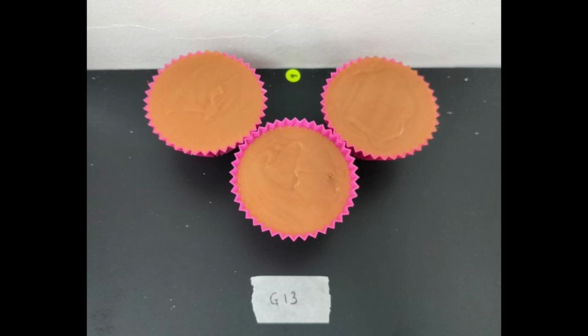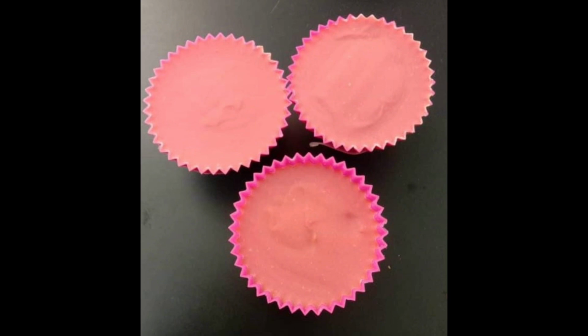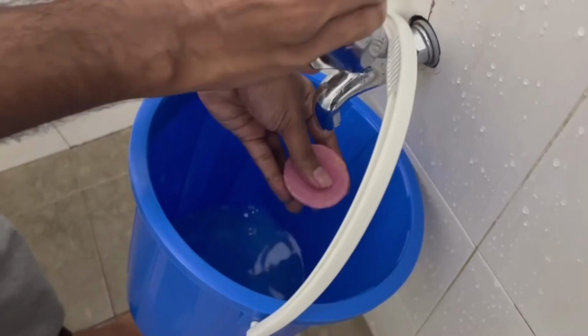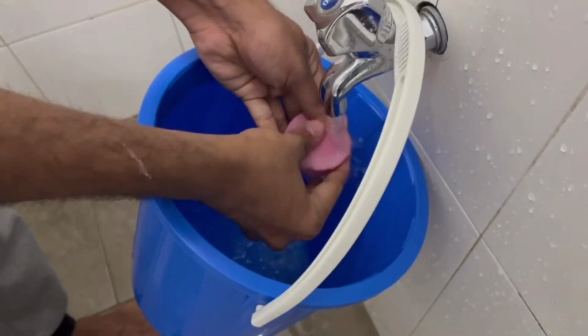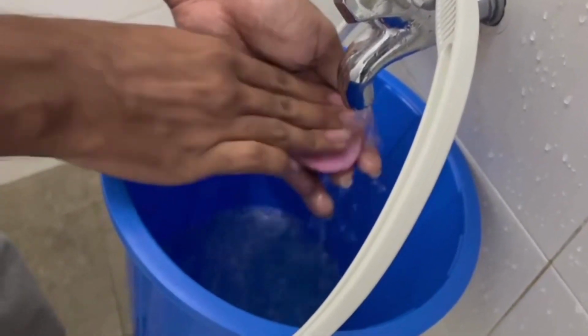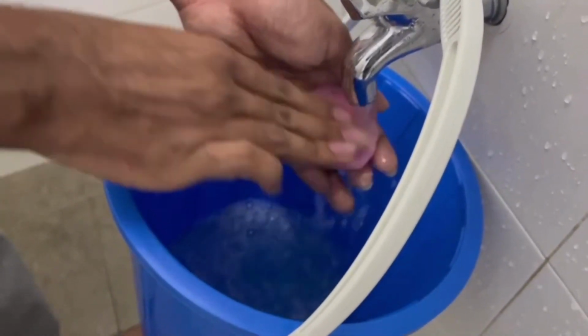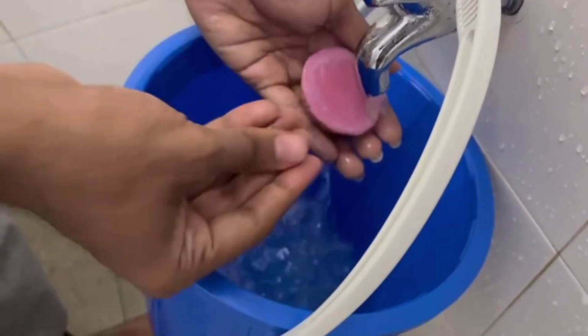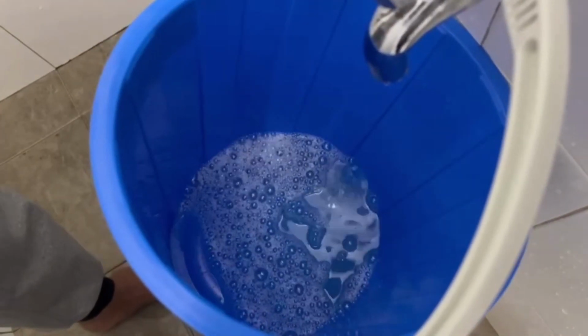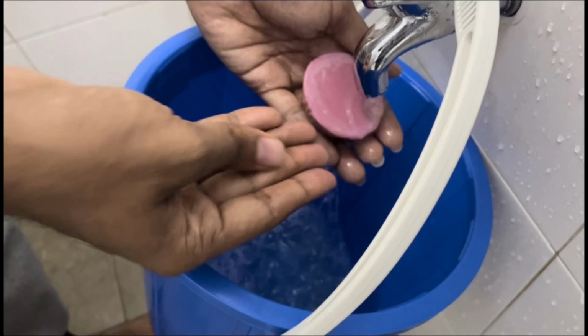Bubbly foam is produced when soap is agitated in the presence of water. Soap molecules have both hydrophilic and hydrophobic parts. The hydrophilic heads are attracted to water, while the hydrophobic tails are repelled by water. As the soap lifts particles off the surface, they become encapsulated in bubbles. The hydrophilic heads of the soap molecules orient themselves toward the water, and the hydrophobic tails remain inside the bubble, surrounding the trapped impurities. The smell of the soap was coffee due to the addition of coffee essential oil.